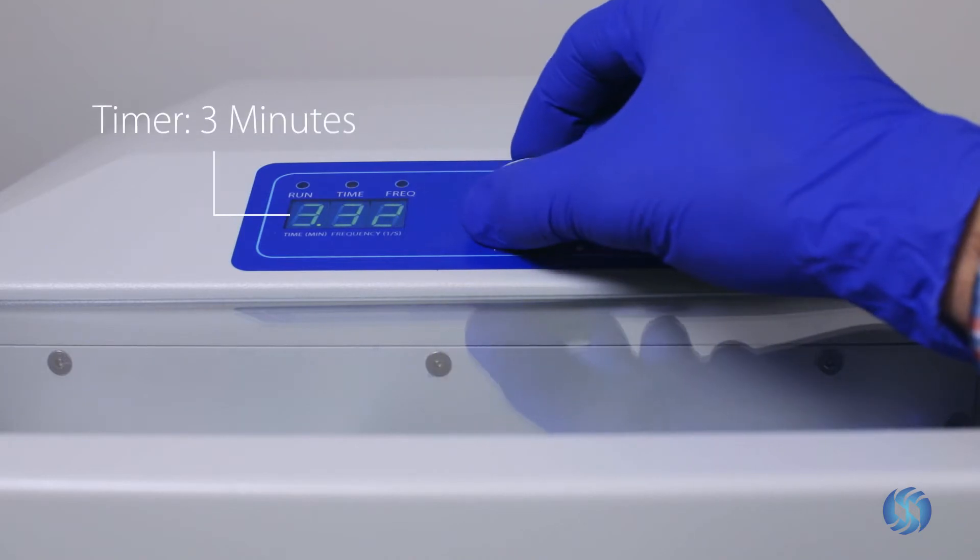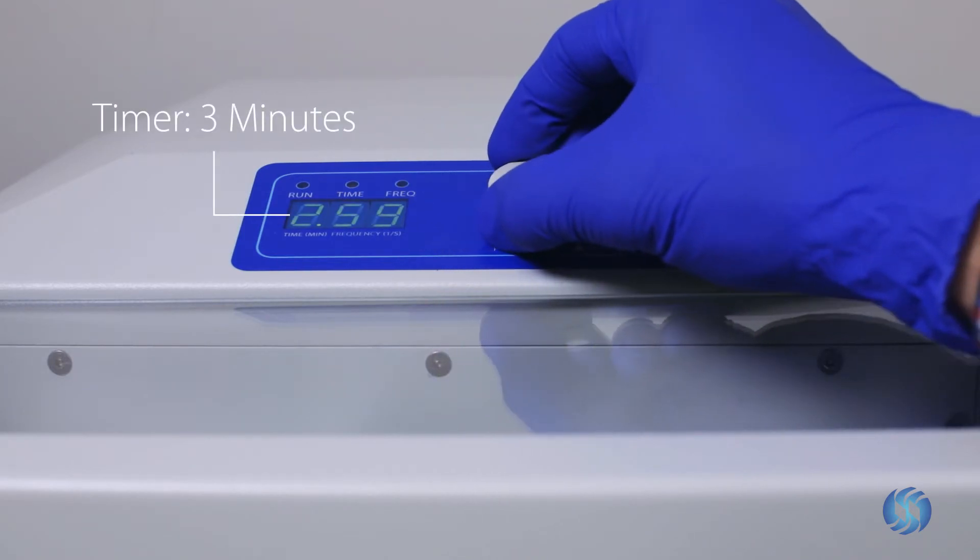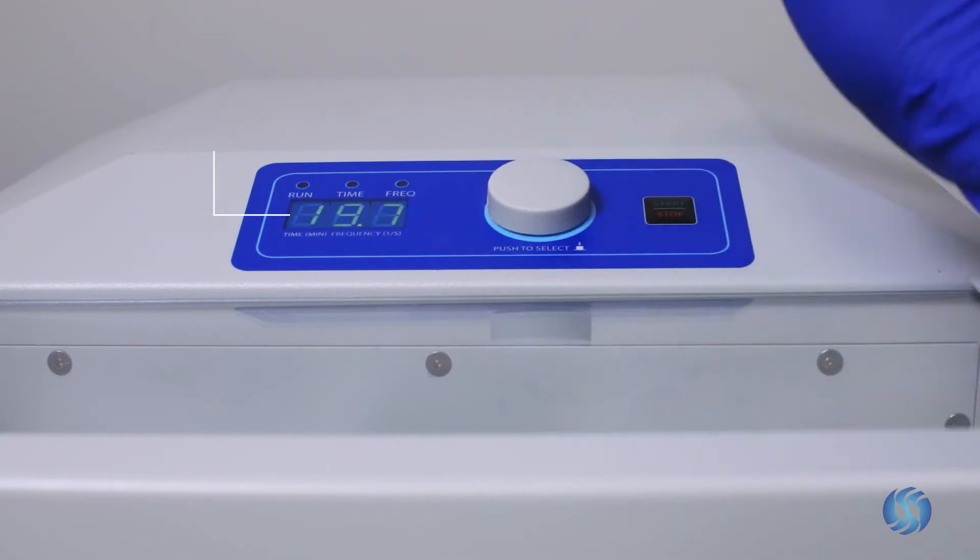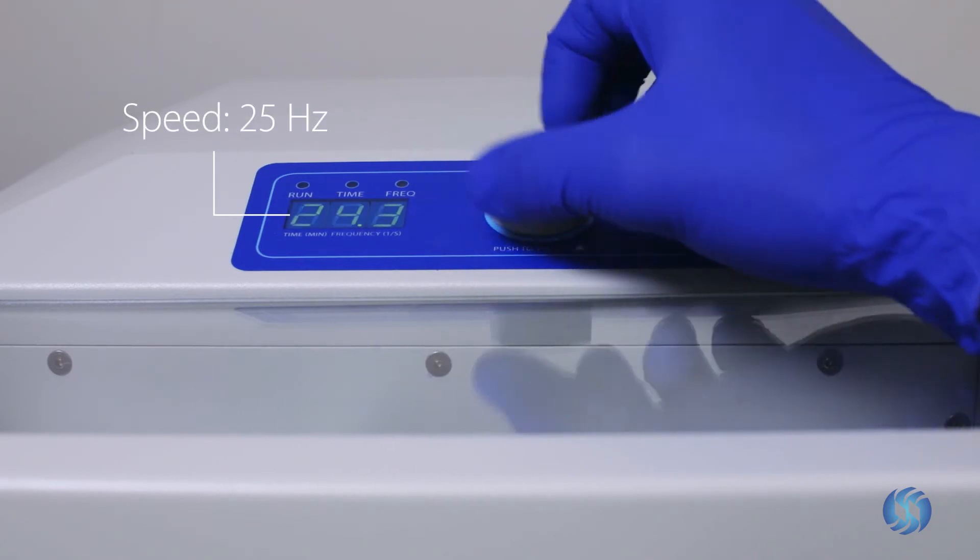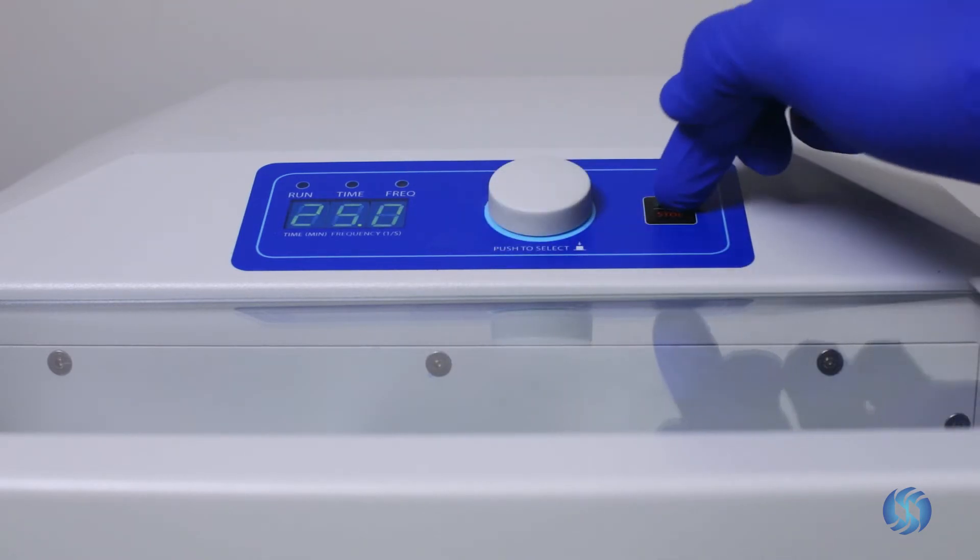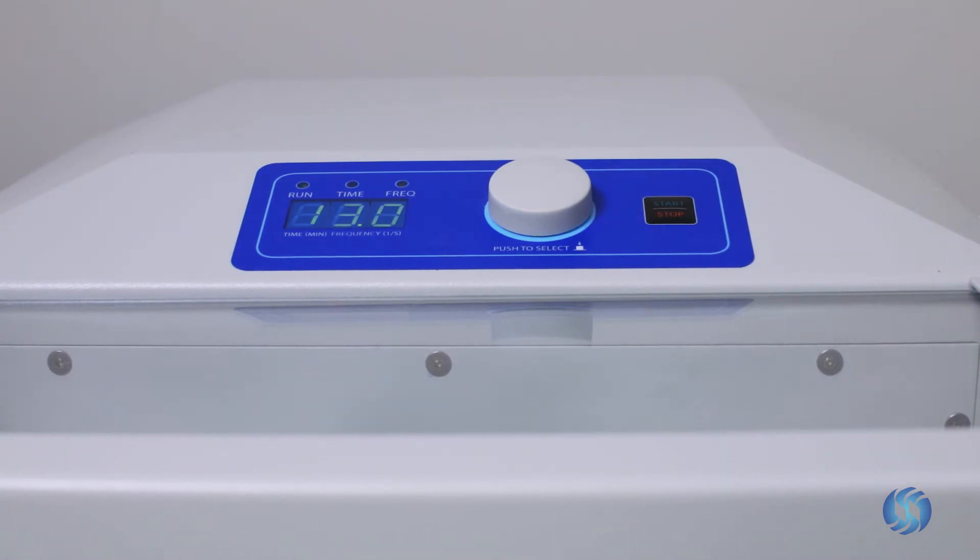Set the timer for 3 minutes and the speed control to 25 hertz. Press the start button to begin the processing cycle.